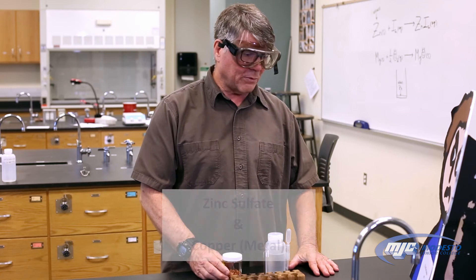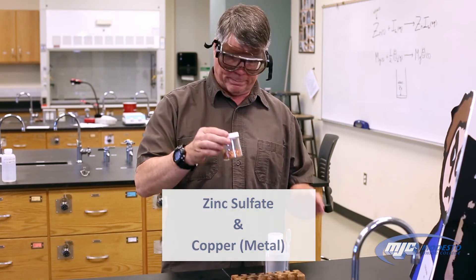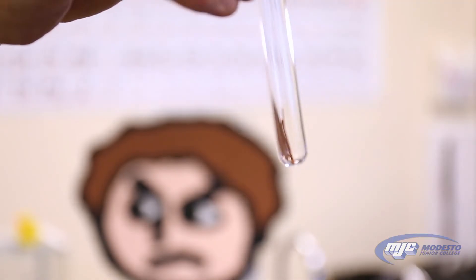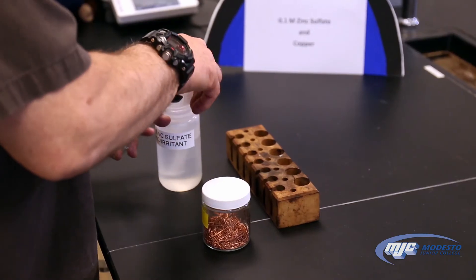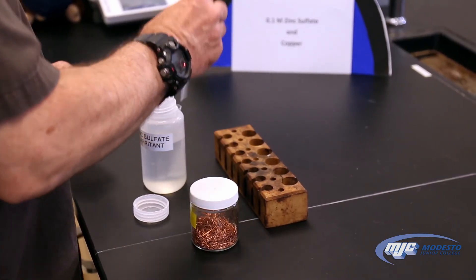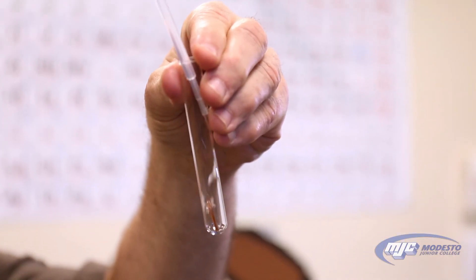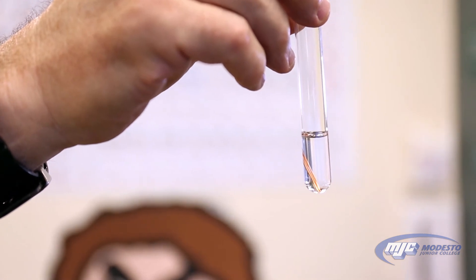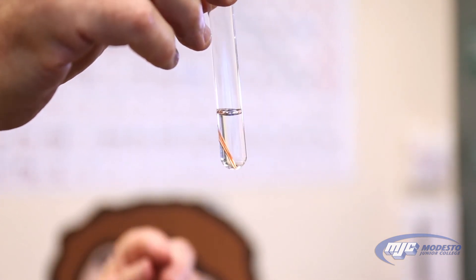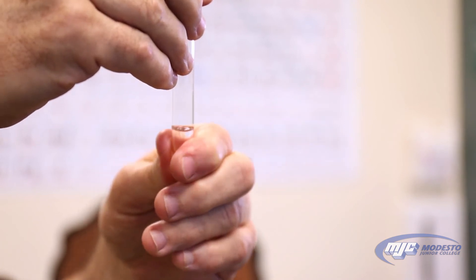This is the reaction, if any, between zinc sulfate and copper metal. There's no temperature change — it's neither getting colder nor hotter.